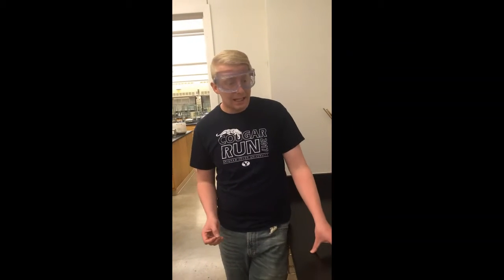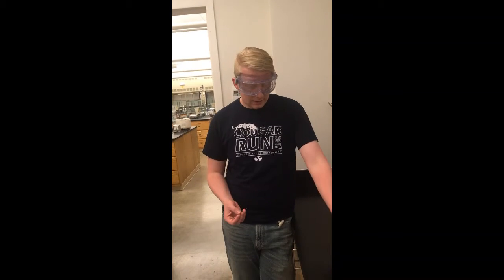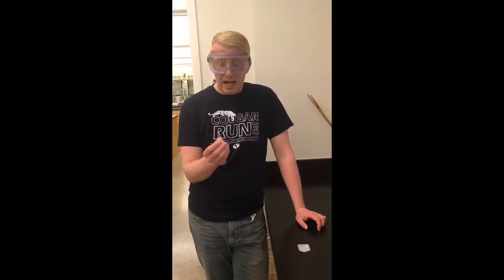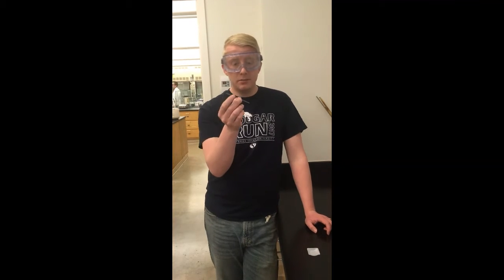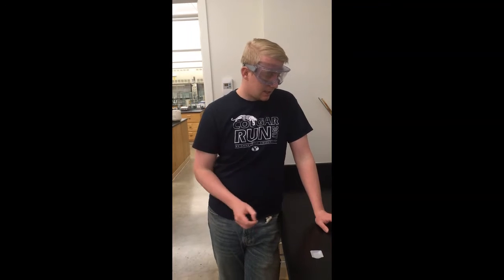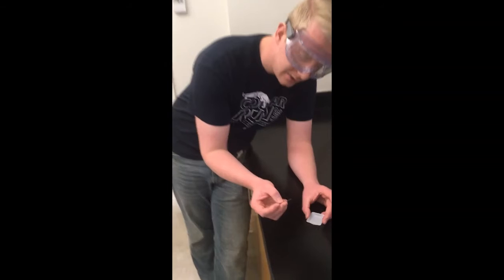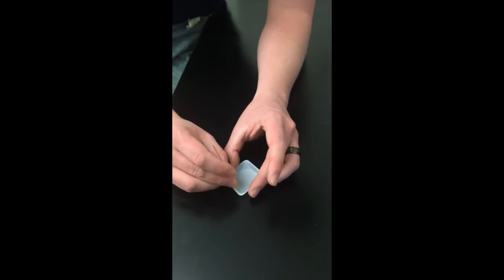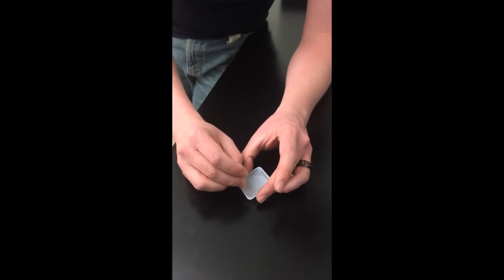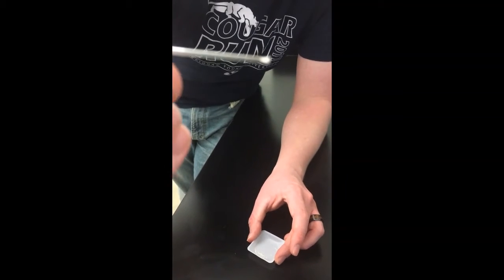Okay, hi everybody. Today I'm going to be explaining how to take a melting point of a solid compound. So what we're going to need is our sample here, and we have a glass capillary tube that's open on one end and closed on the other. So this will allow us to collect the sample and then go ahead and melt it. To collect a sample, I'm just going to take the open end of this capillary tube and tap it repeatedly against my crystals. This is just going to start to pack some of this solid inside the mouth of this tube, as you can see there.